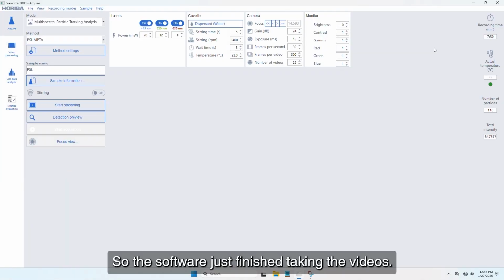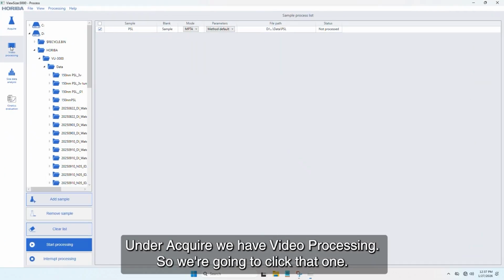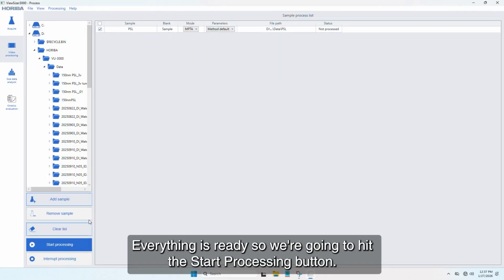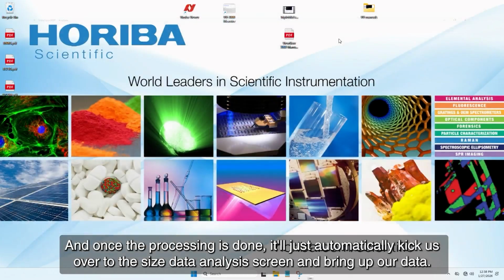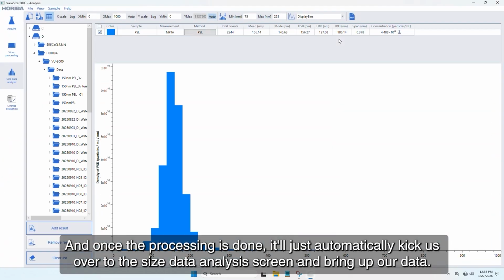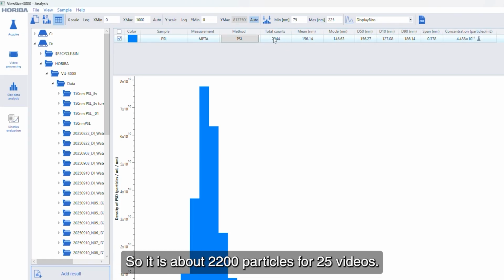So the software just finished taking the videos. On Acquire, we also have video processing, so we're going to click that one. As everything's ready, we're just going to hit the Start Processing button. And once the processing's done, it'll just automatically kick us over to the size data analysis screen and bring up our data. So on the top here, we can see how many particles were actually counted in all of our videos. So it was about 2,200 particles for 25 videos.